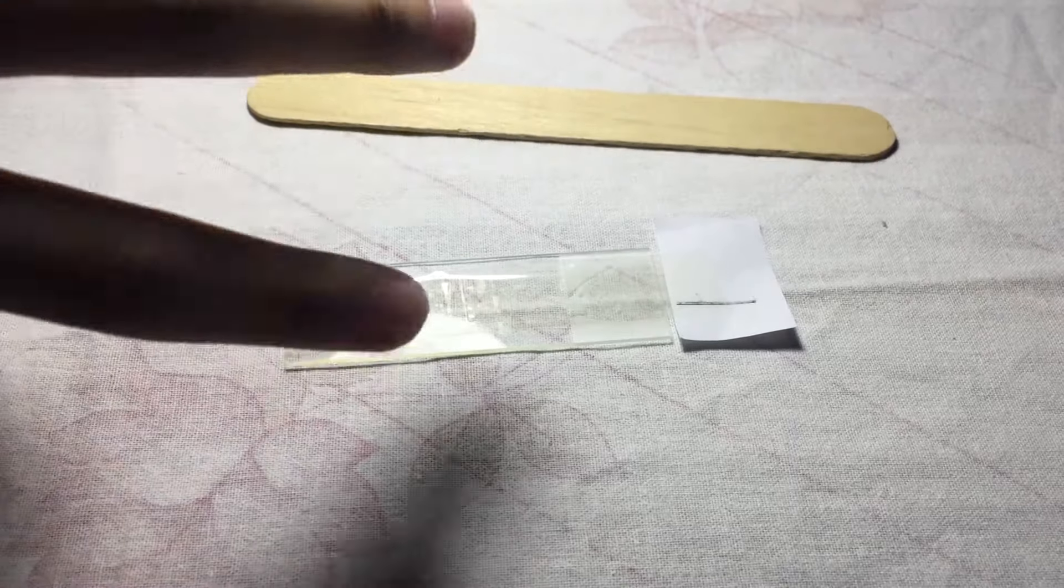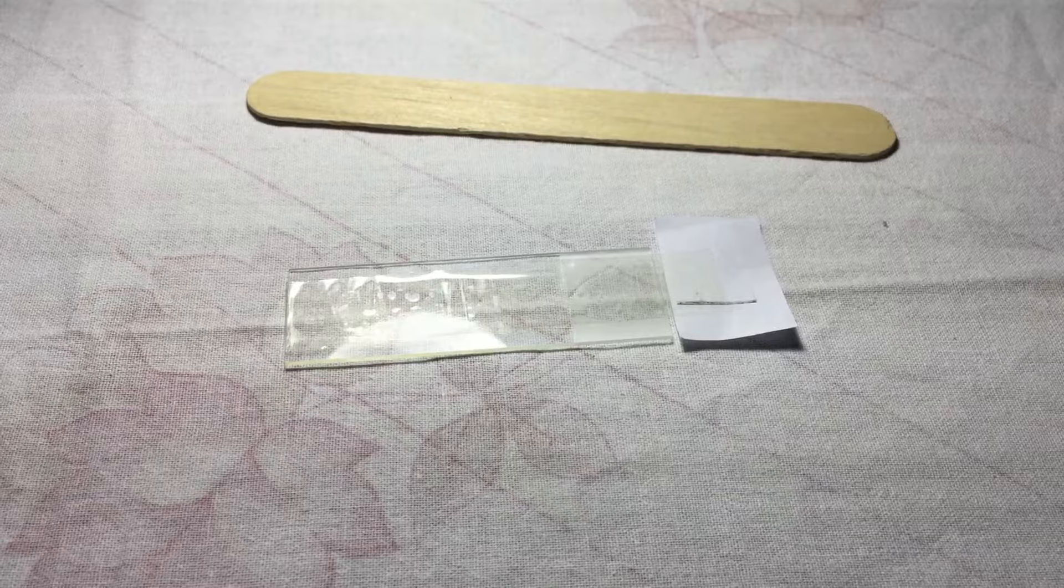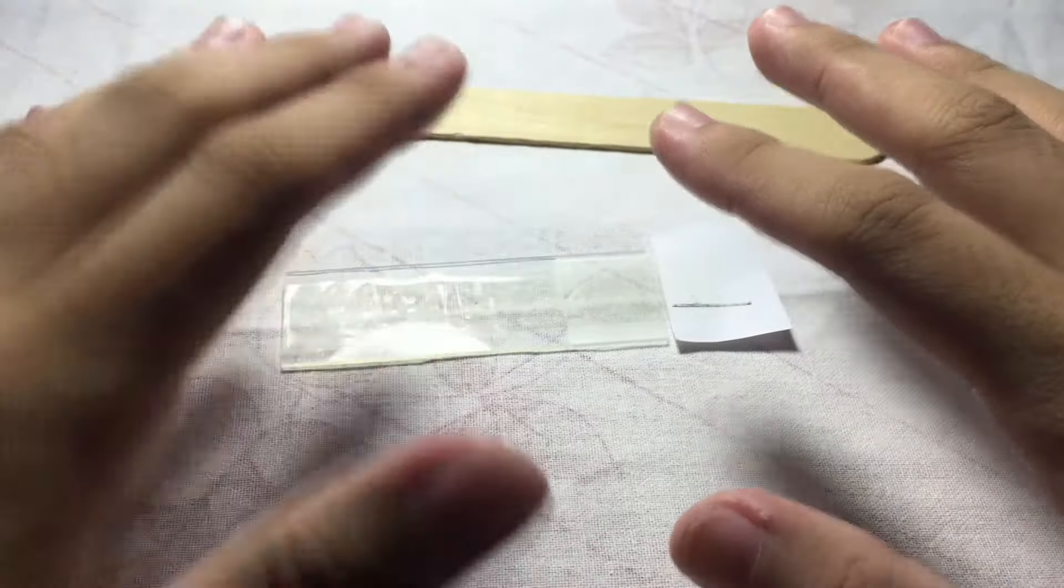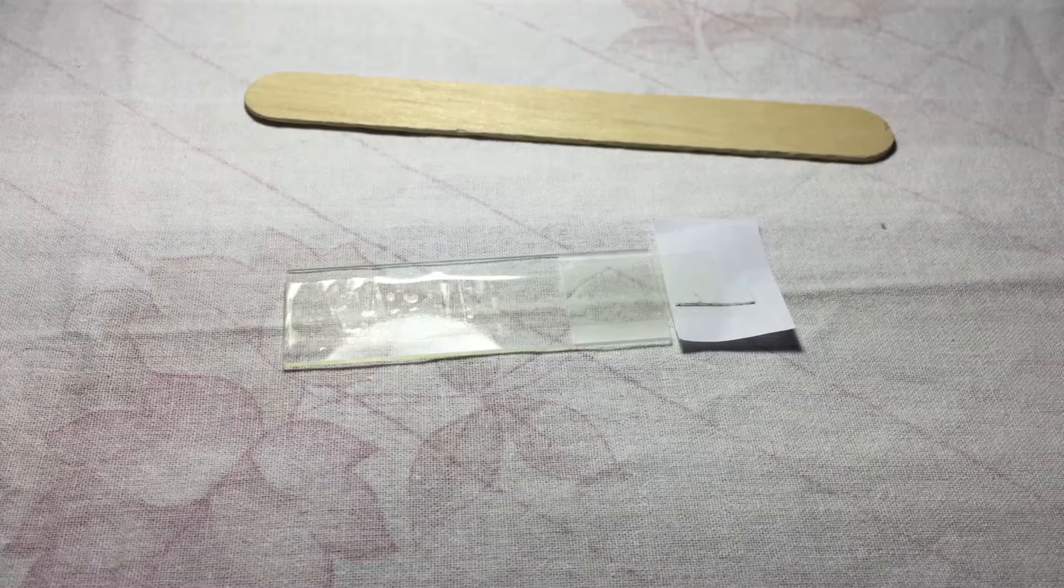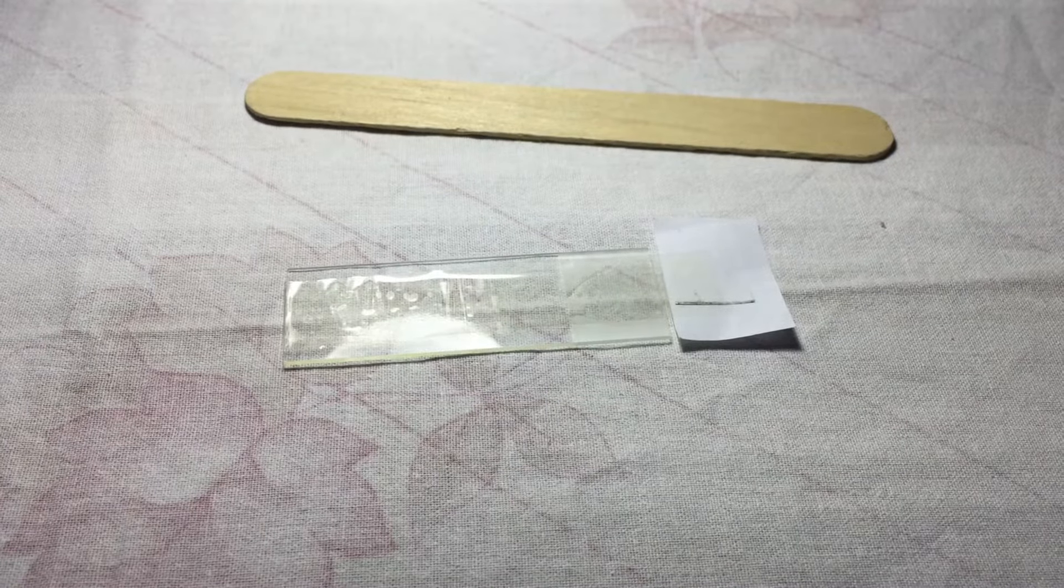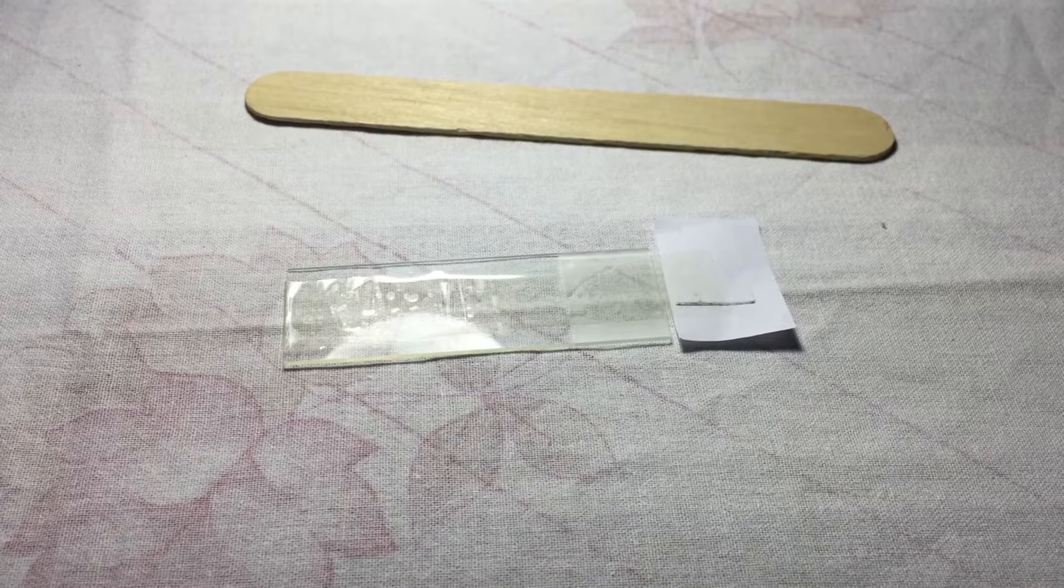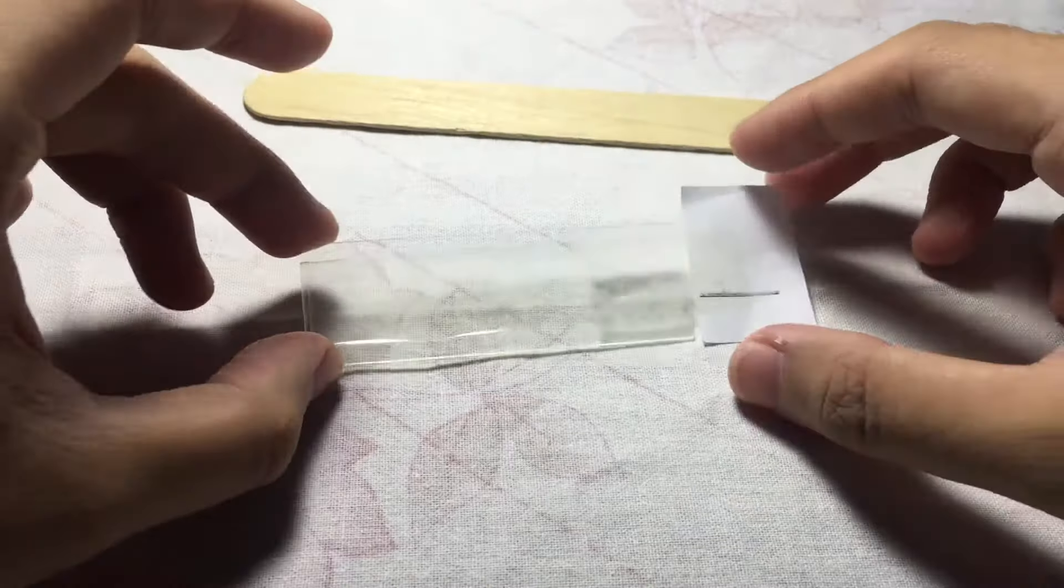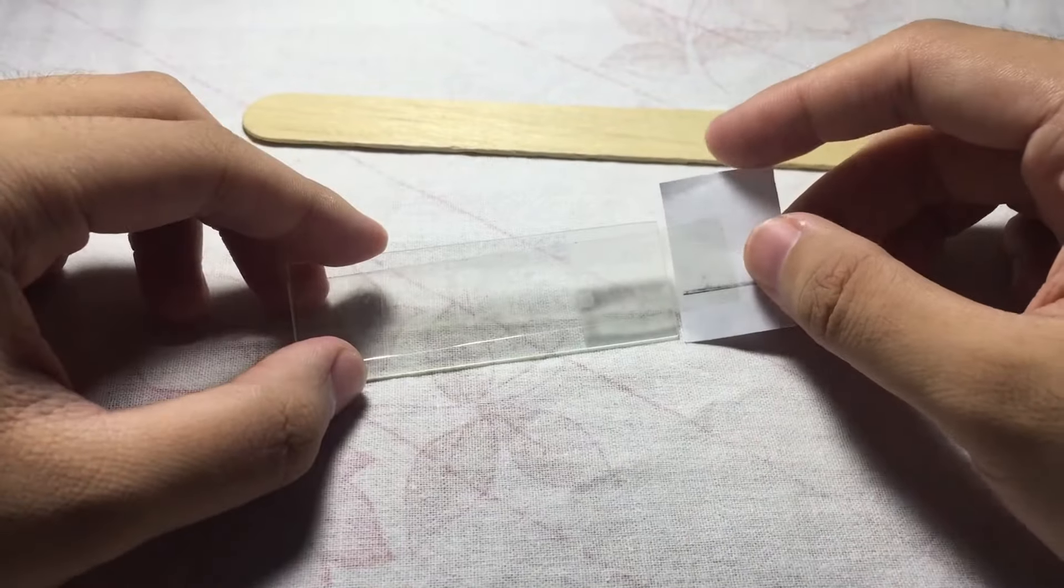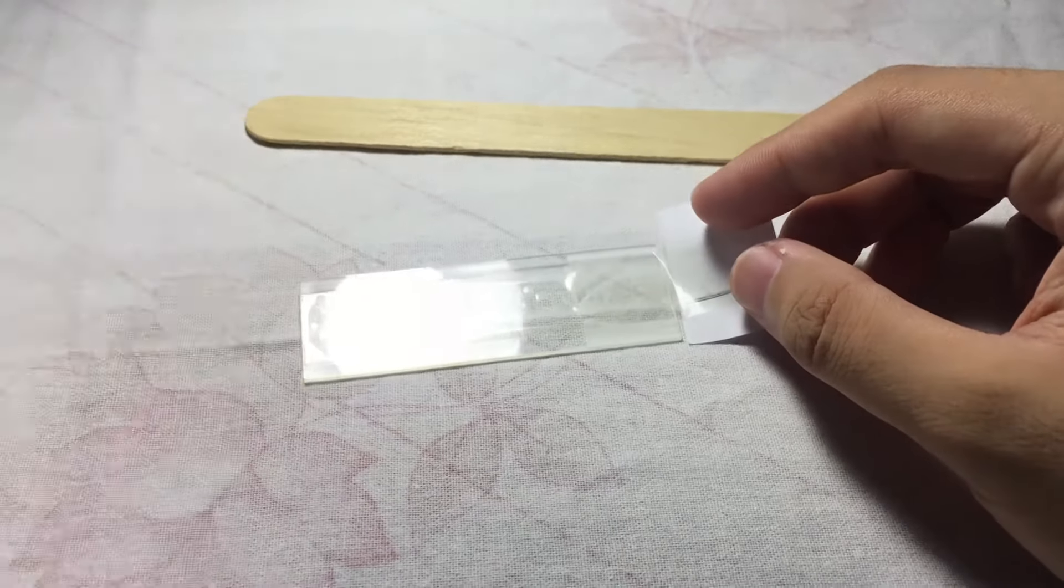As a precaution, you should be already wearing your complete PPE: gloves, mask, and lab gown, because recall that your eggs are highly infectious so we must protect ourselves. Using this scotch tape swab flap, it's recommended to use papers with hard texture or sturdy, like index cards, because it can withstand when you pull it.